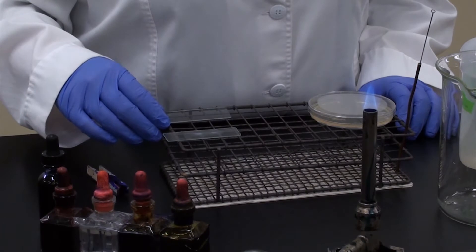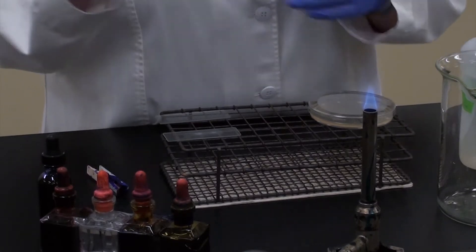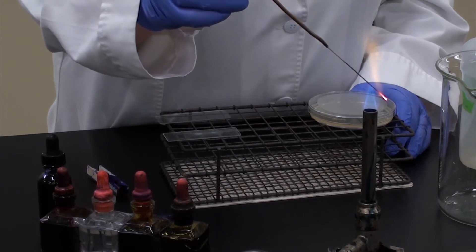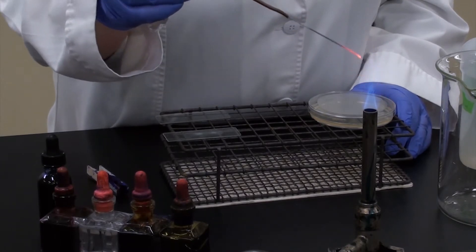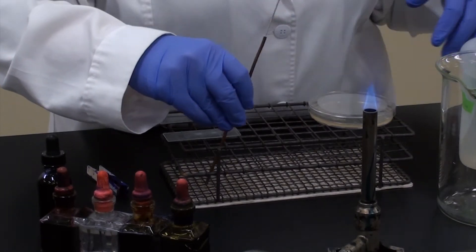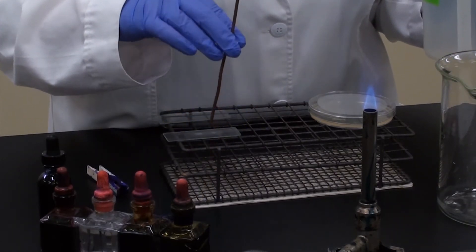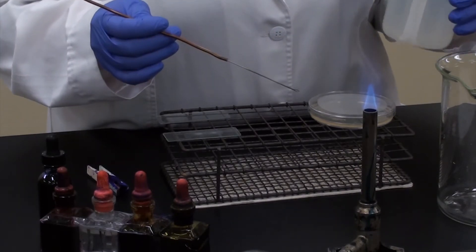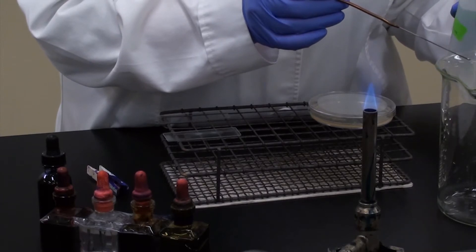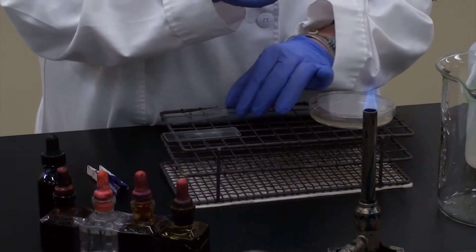I'm going to demonstrate how to do a simple stain, how to set up the slide and flood it. First I'm going to take my loop — as always, aseptic technique — flame your loop from the loop all the way down the stem. Now I'm going to set it off to the side to prep my water. I'm going to get a small amount of water on my loop. You can see it sizzling — that loop is still hot. It's okay, I don't have any bacteria yet; right now I'm just transferring water.